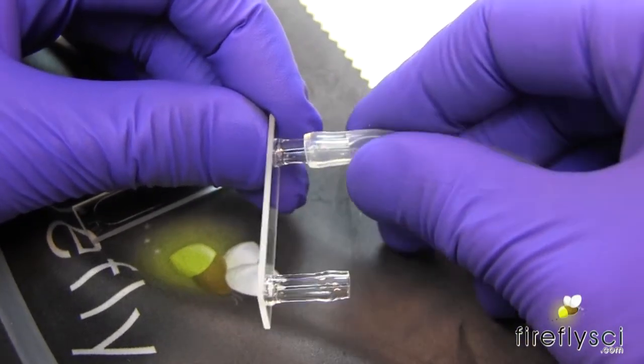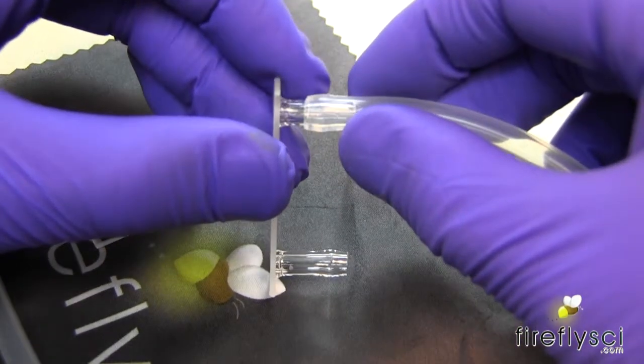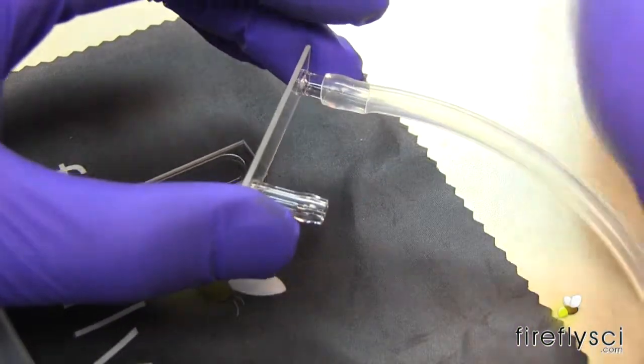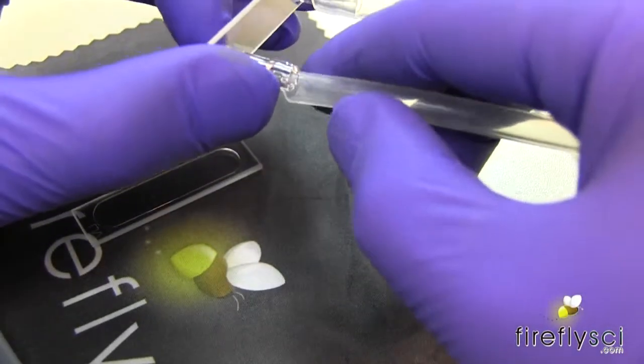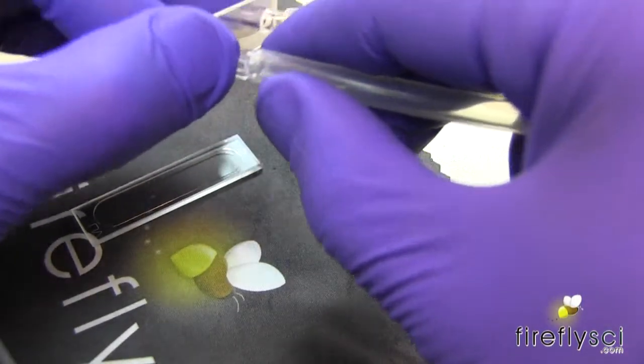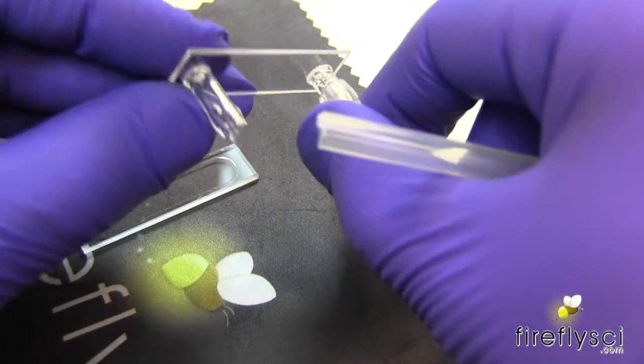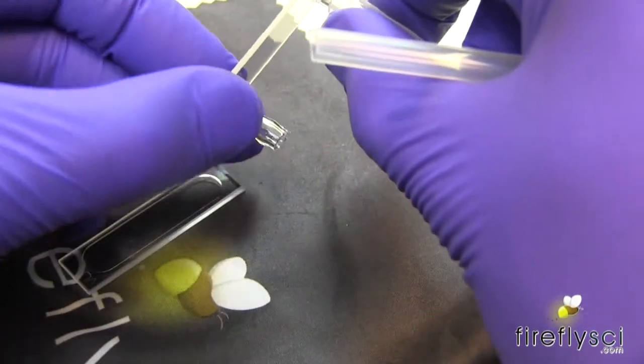And they should just slide nicely on. Again, I'm not using a crazy amount of pressure here, just pushing it on gently. And you want to also hold it in the back. See, I have my finger back here giving it extra support.